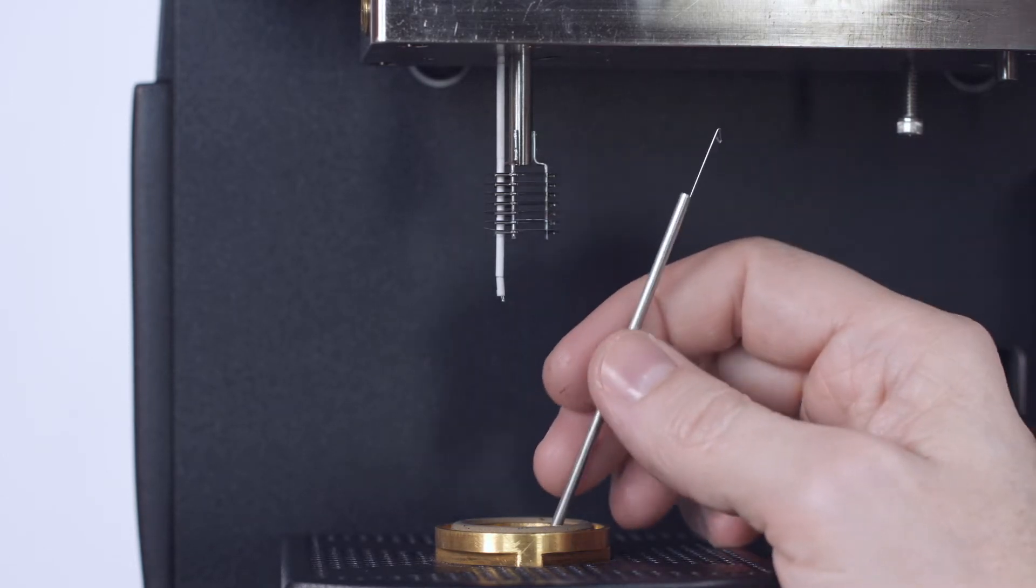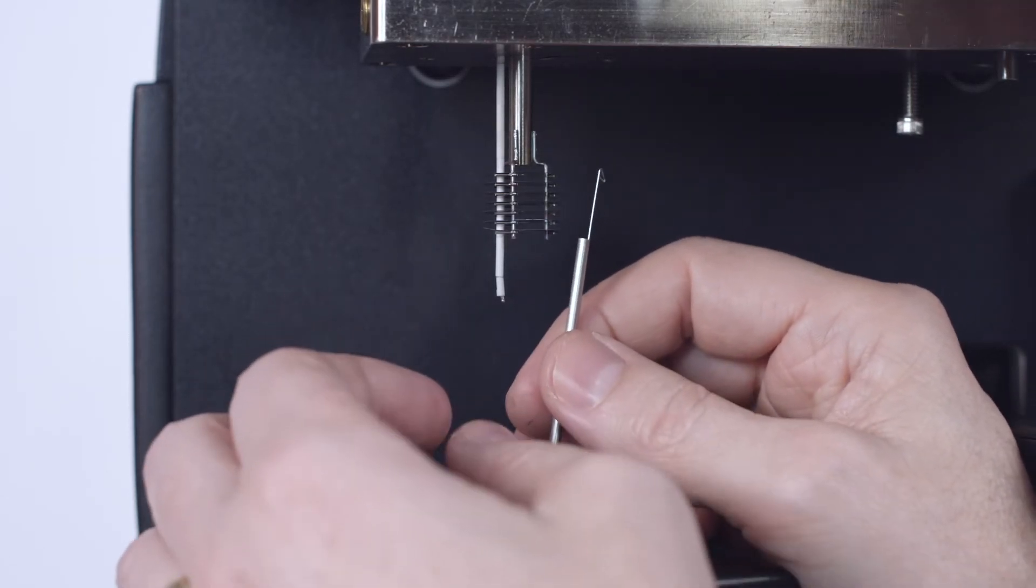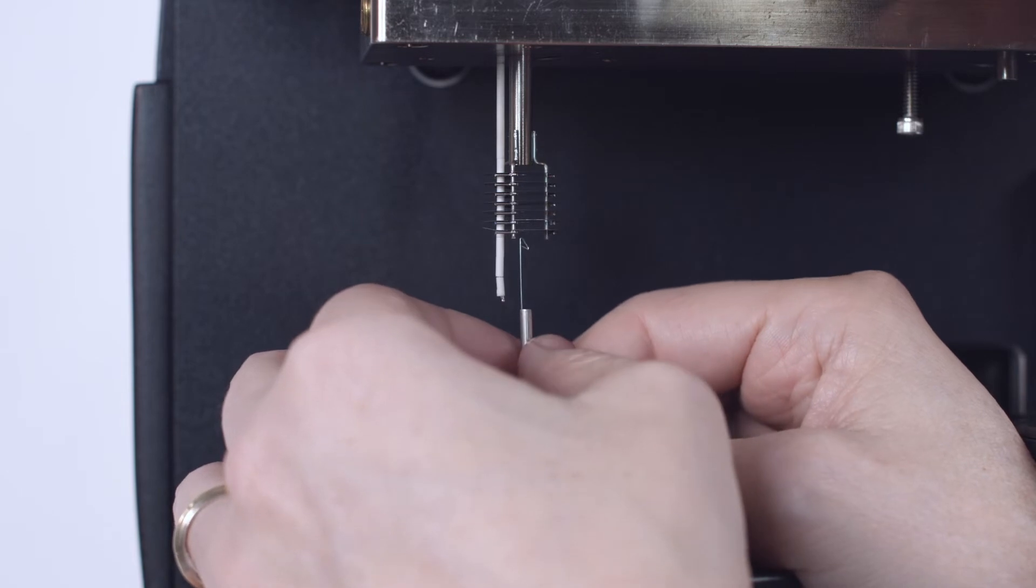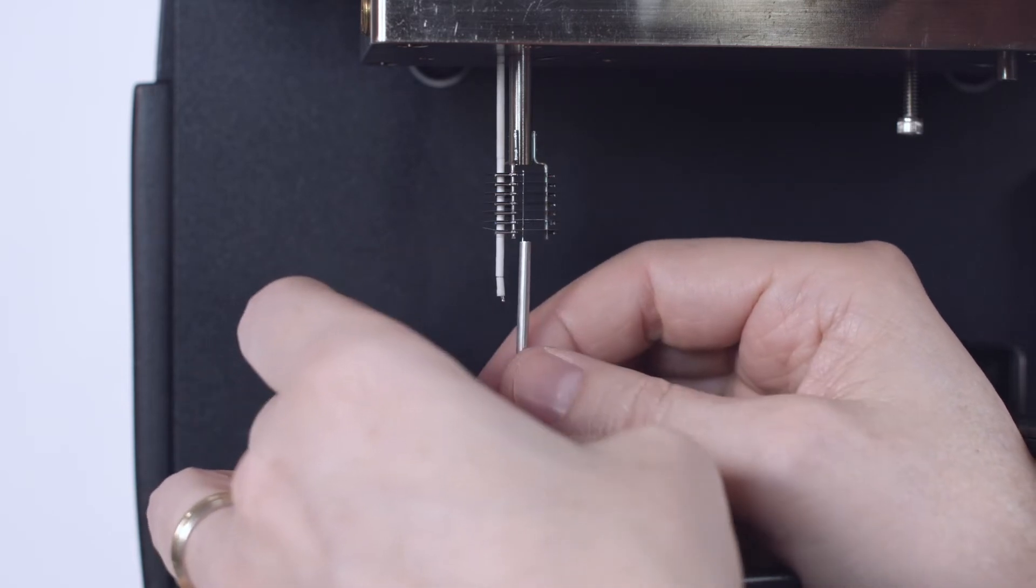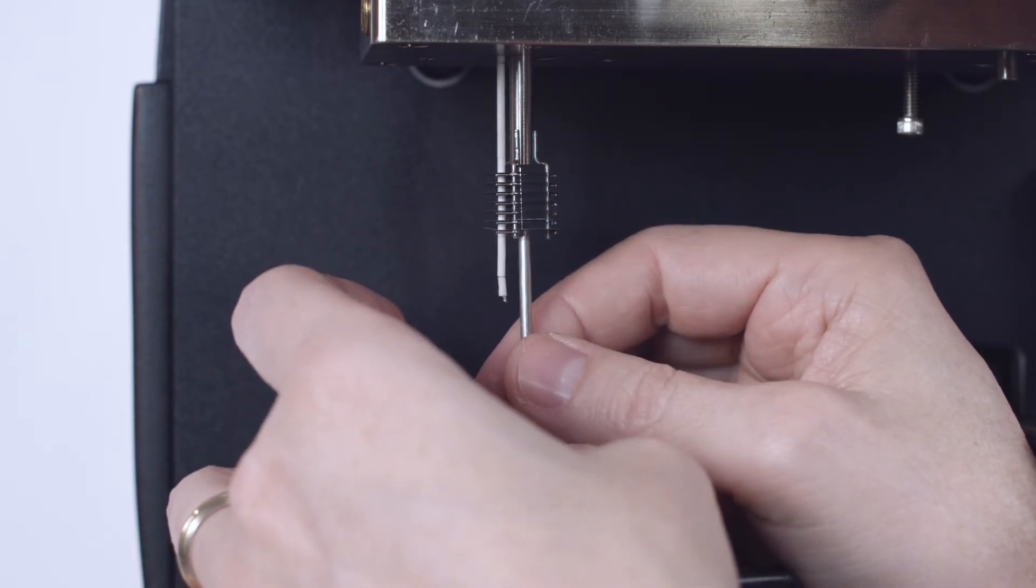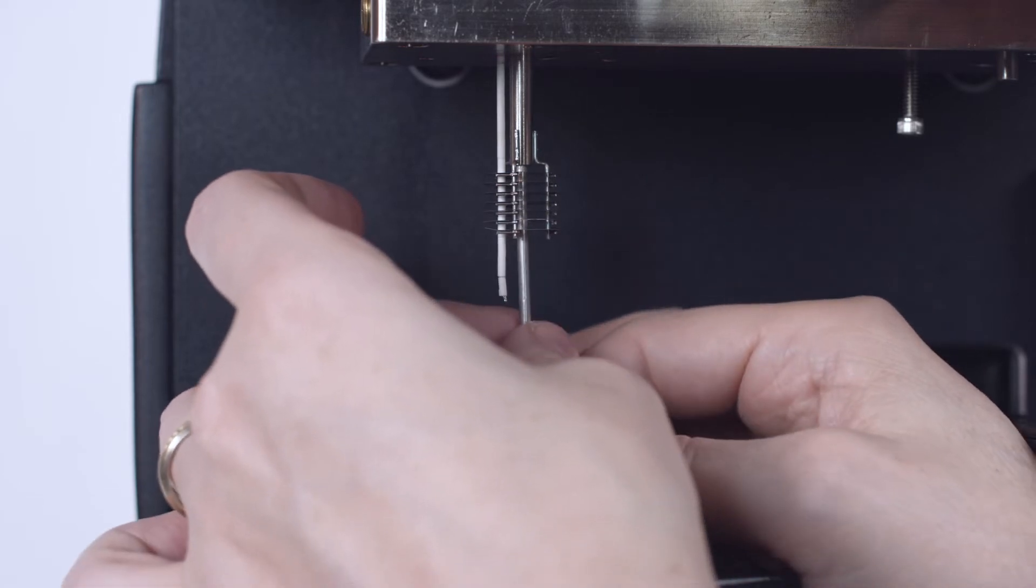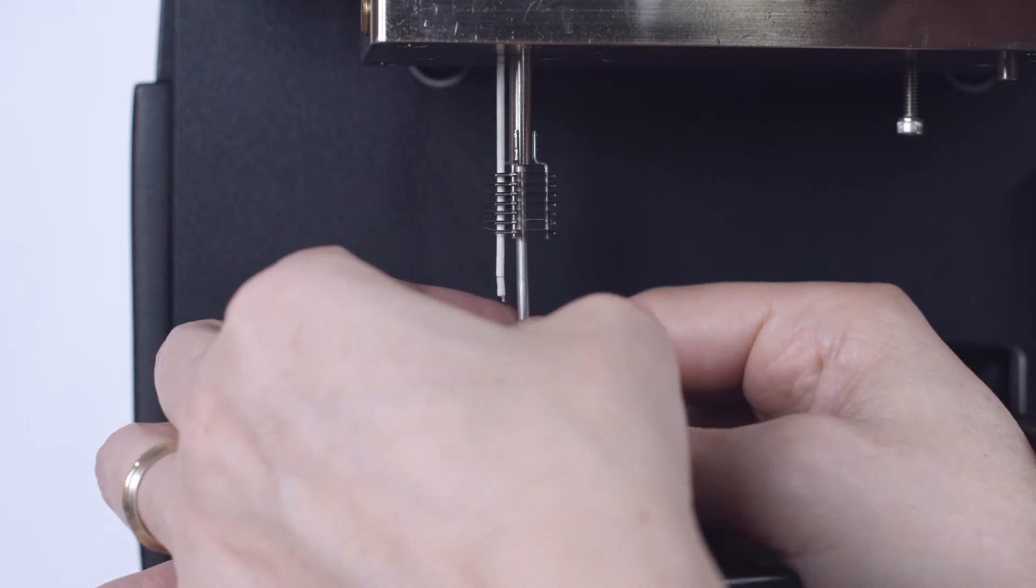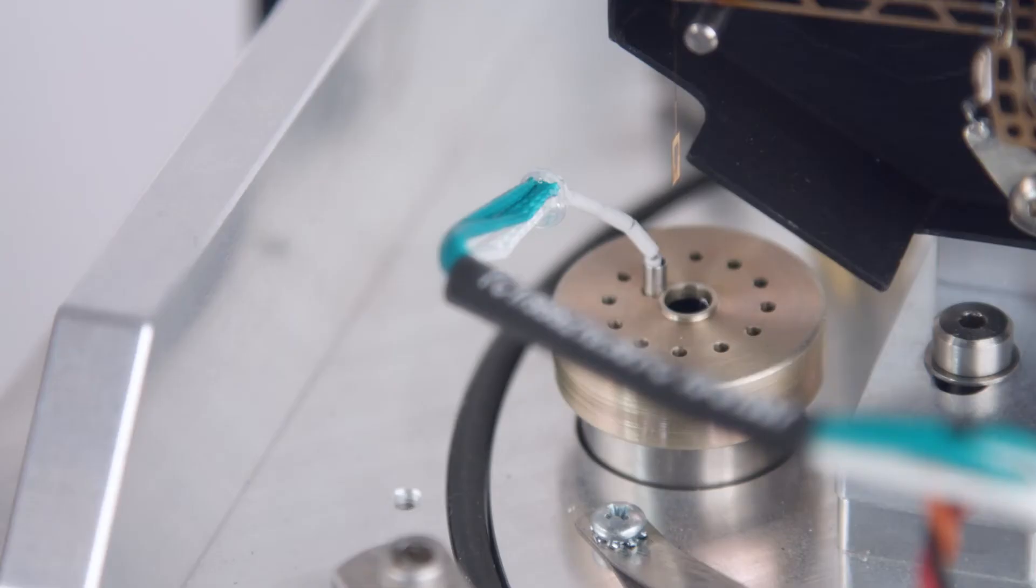Insert the tool partially into the furnace and then slowly raise the tool being careful to insert it and the hang down wire into the hole in the upper furnace assembly. Raise the tool until the hang down wire is visible from the top. This may require moving the thermocouple to the side or up.